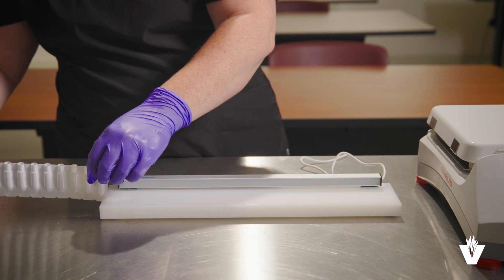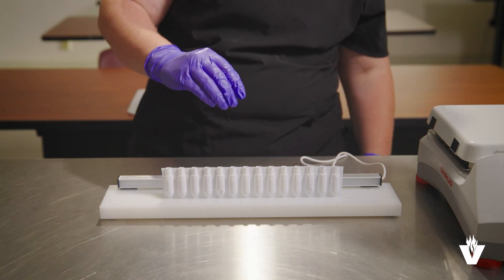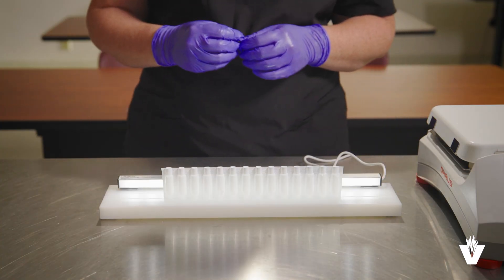While waiting for the mixture to cool, set up the disposable molds. If the molds are opaque, use a backlight which allows you to see the mixture going into the mold.